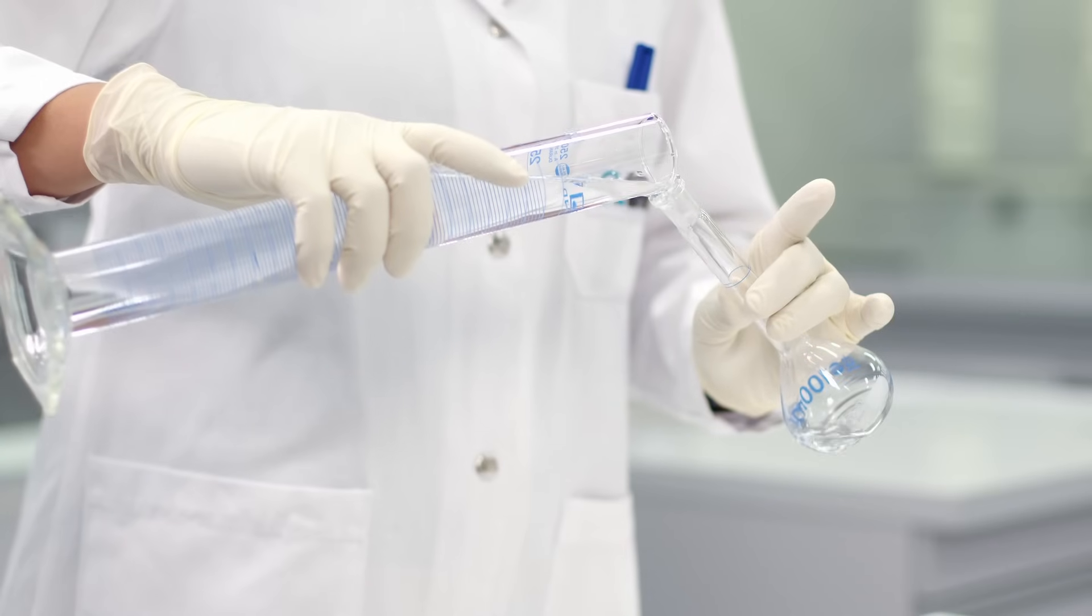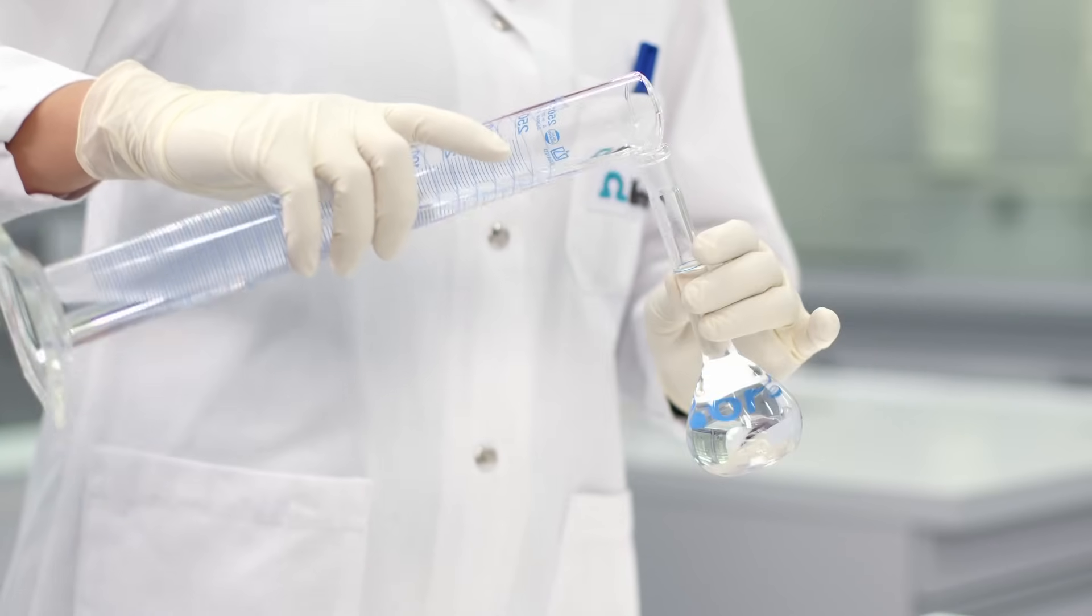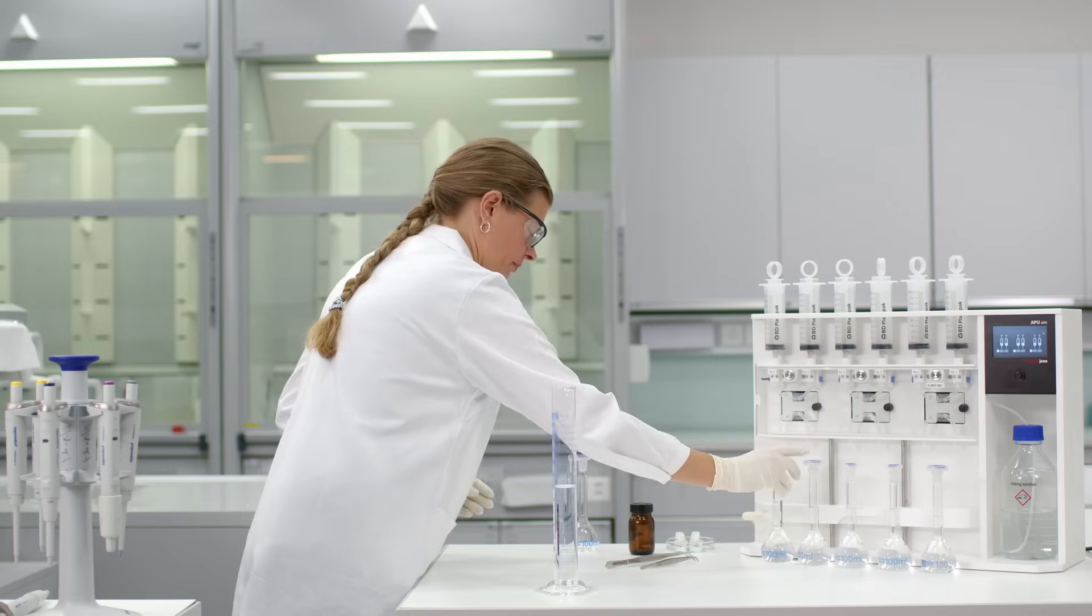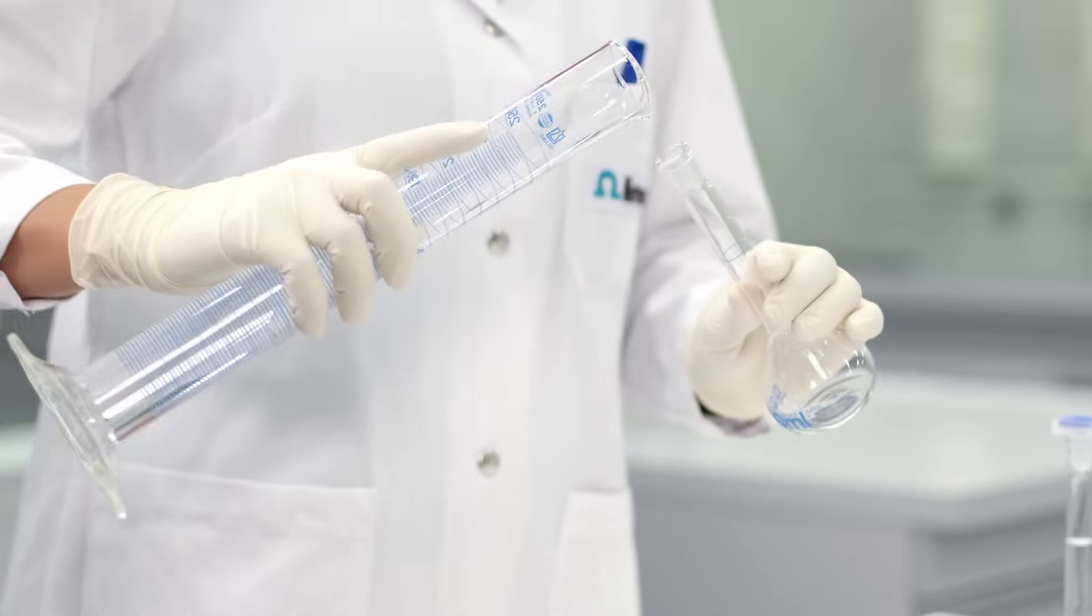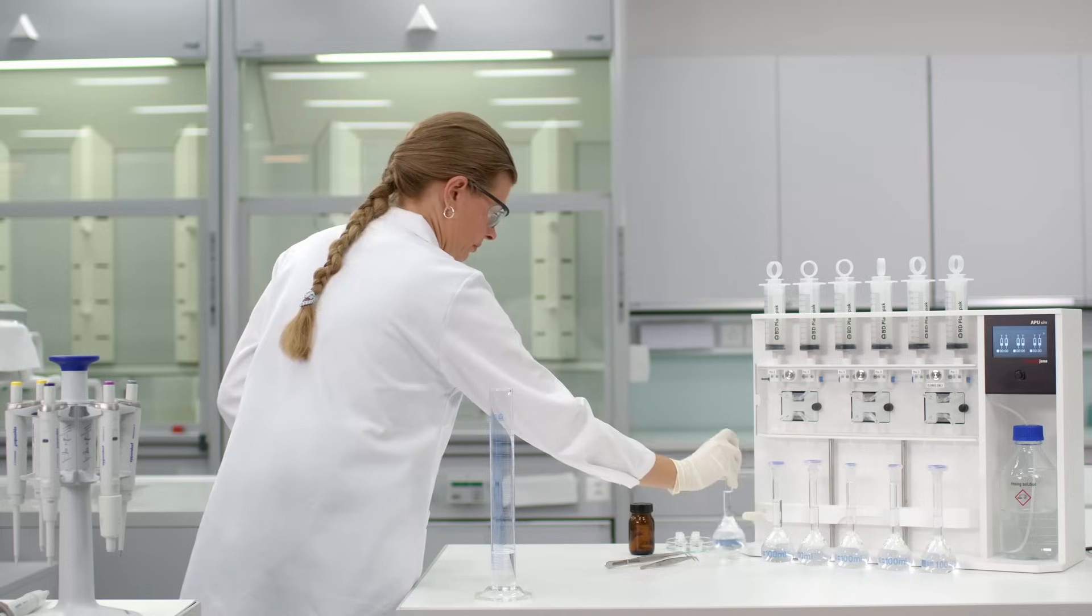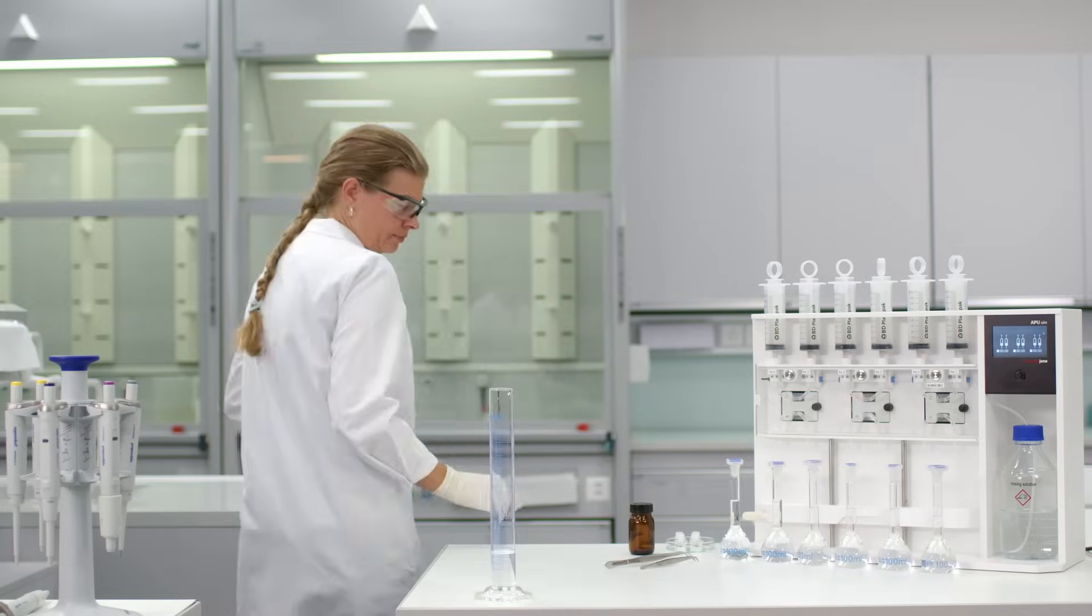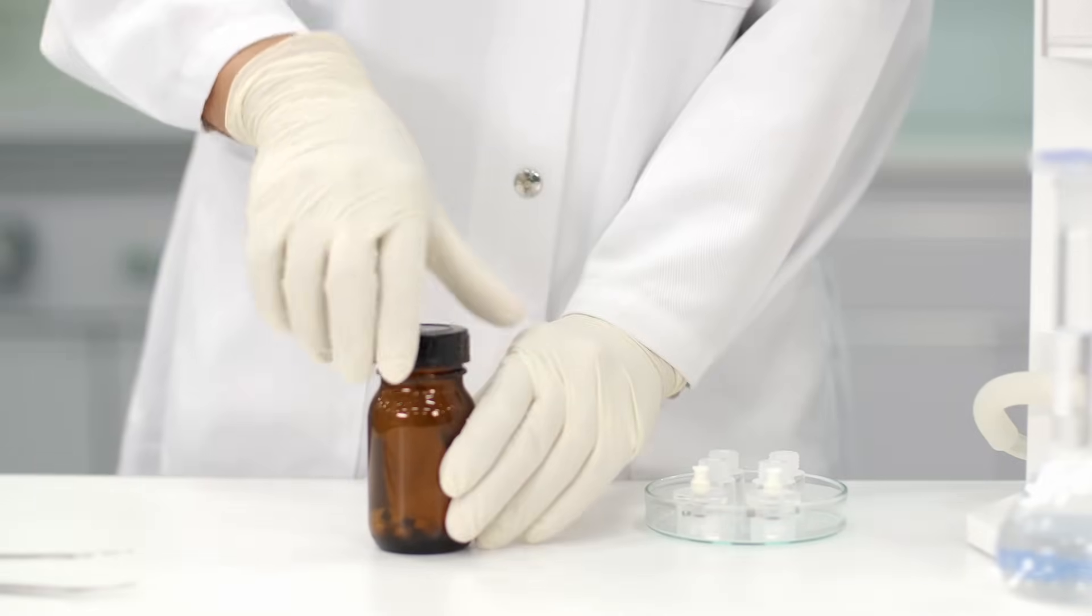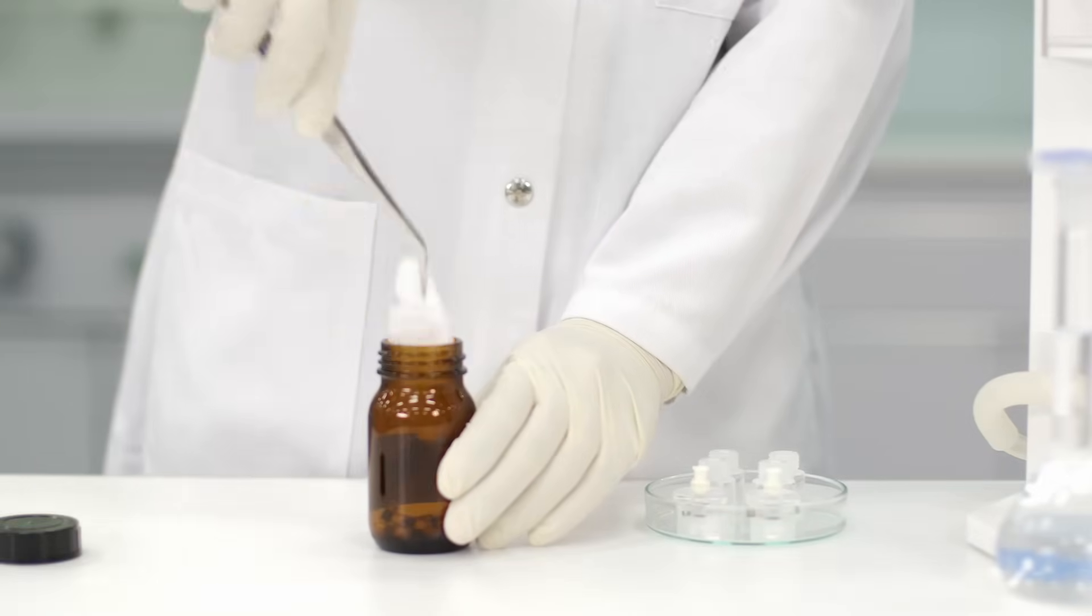Measure out exactly 100 milliliters of this spiked sample and place two activated carbon columns into the sampling cartridge.